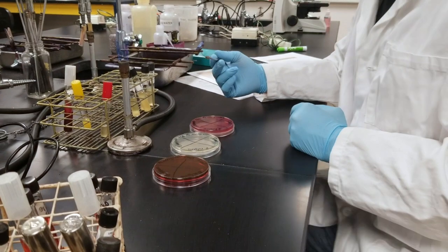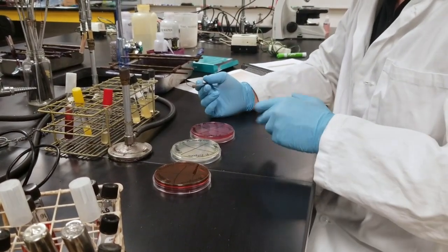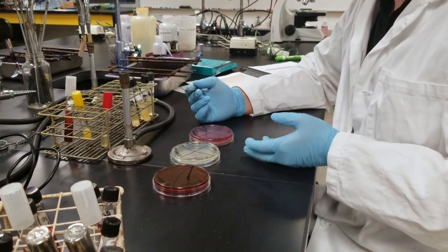Today we're going to be looking at enteric bacteria. We have a couple of differential media that we're going to use.